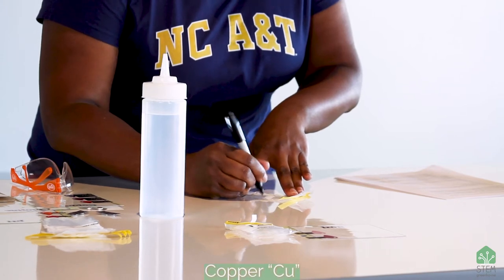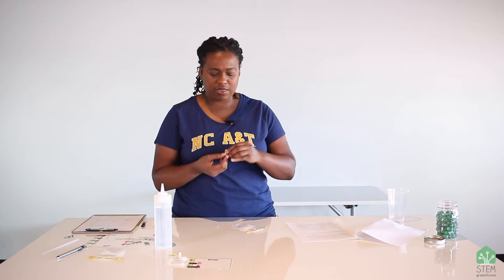The next one we're going to do is copper. I'm going to start by writing the chemical symbol for copper on the baggie — the chemical symbol for copper is Cu. All of these chemical symbols are on a periodic table; that might be something you want to look up online so you can see the symbols or letters that represent those elements. I'm going to remove the tablet first, because once you pick up the bag it's hard to set it down without spilling the water. The backs of these indicator tablets say what test it is.